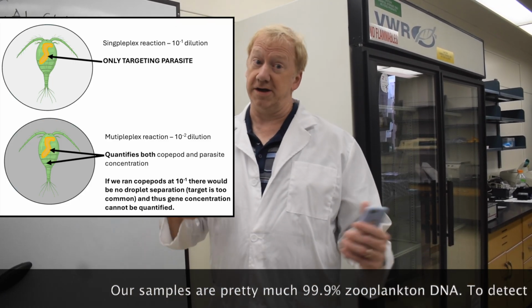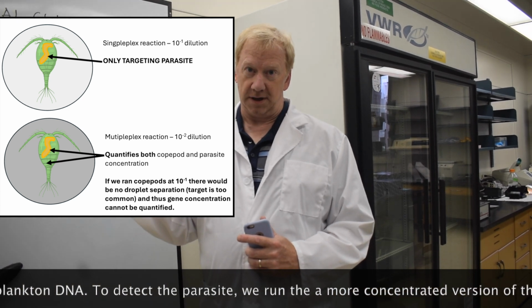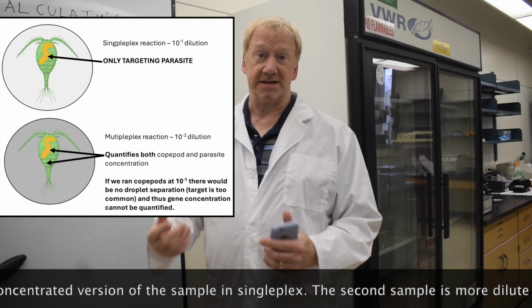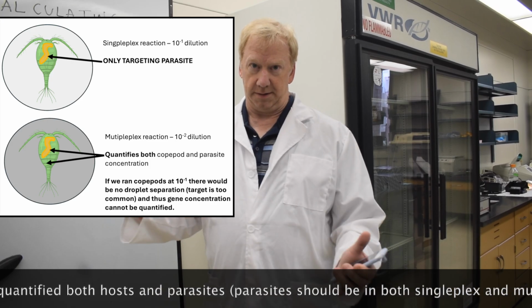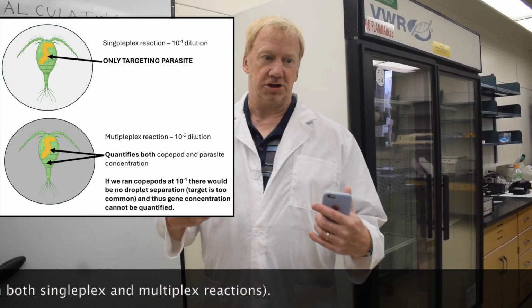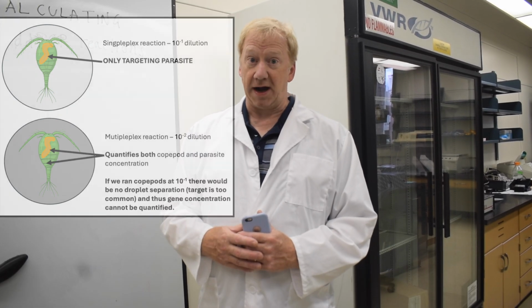Whereas the multiplex reaction, we'll be looking at the copepod DNA as well as the Schistocephalus. And because these samples are basically pure copepod DNA, if we don't dilute it a lot, we'll get too much amplification product and we won't be able to determine how much is there, because every single droplet in the reaction would be positive.